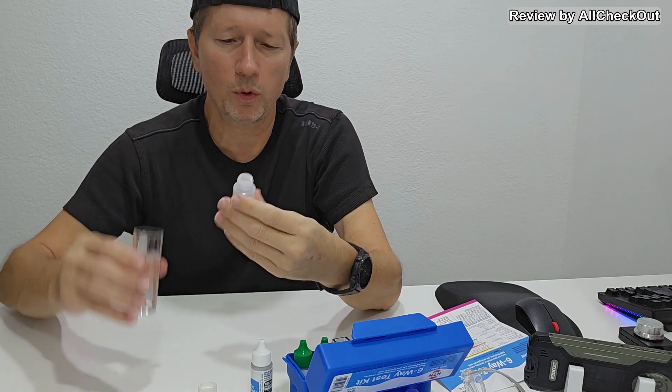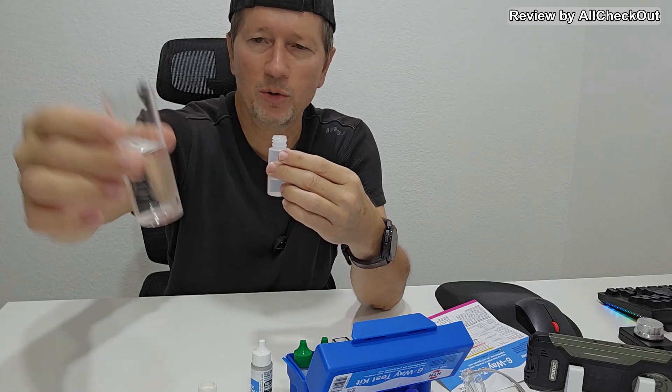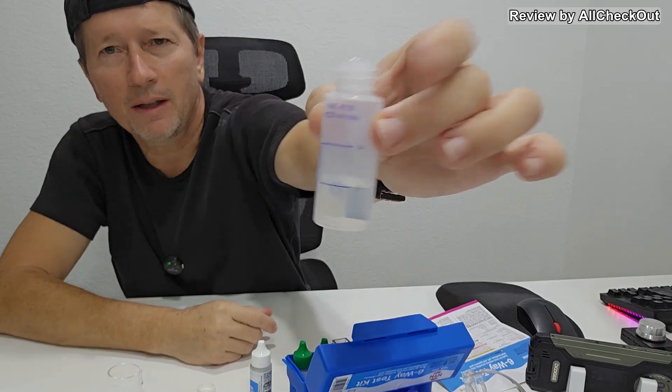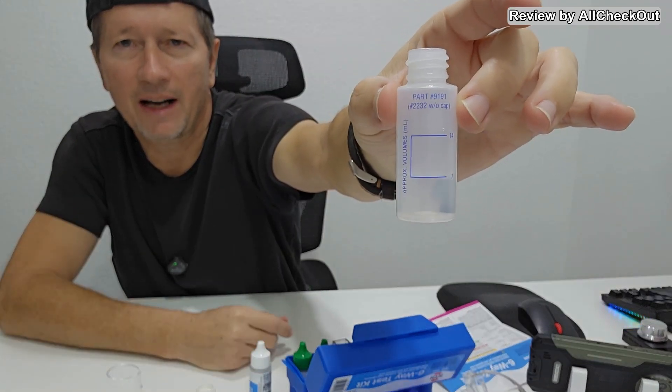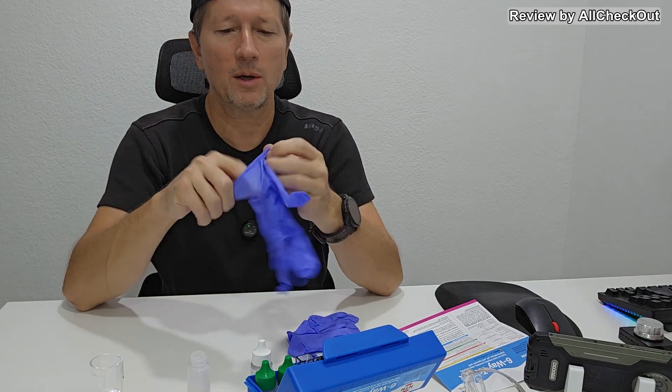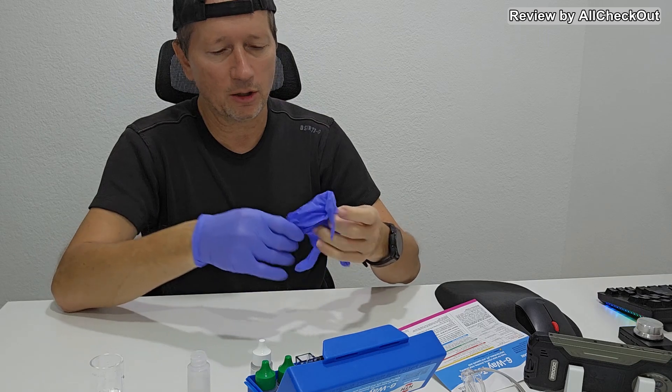Fill it here inside - that's actually the reason why I was using this, because it's very easy to fill it up to a pretty exact level. I hope you can see that's around seven milliliters. Now we start with the chemicals, so highly recommended to use some protective stuff.